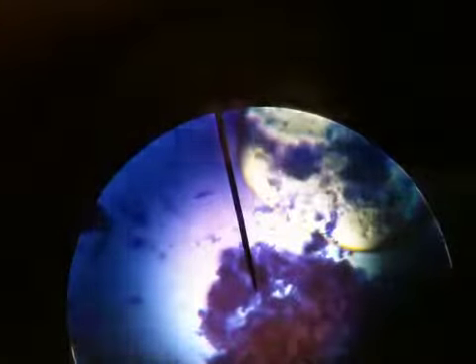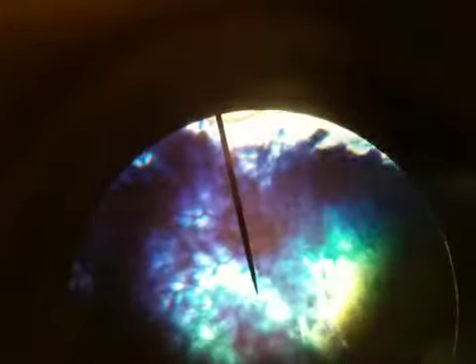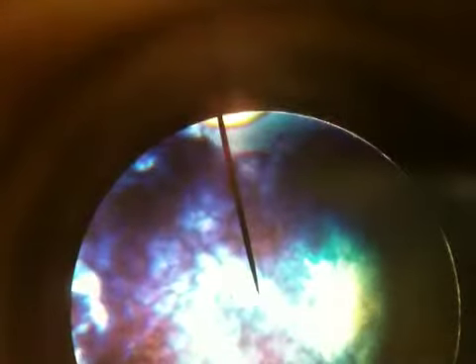So we can focus through the different features of these root cells. So the purpose of this lab is not for root cells, it's to find the bacteria. And this piece that I'm looking at right now, I don't see any bacteria. But if you saw some bacteria in here, you would see them moving around. They'd be swimming around. And so hopefully we find at least one sample with some bacteria.